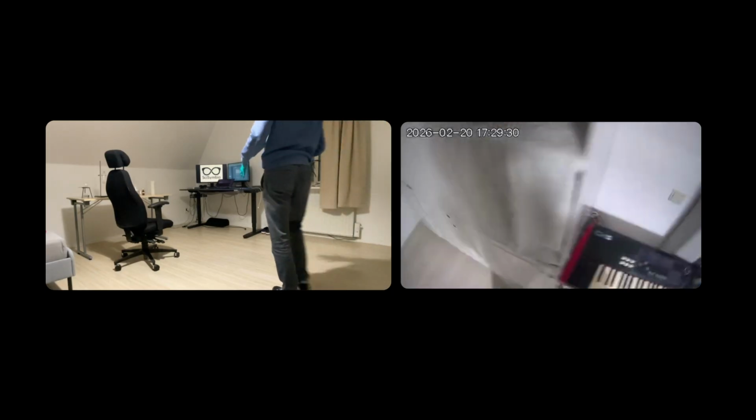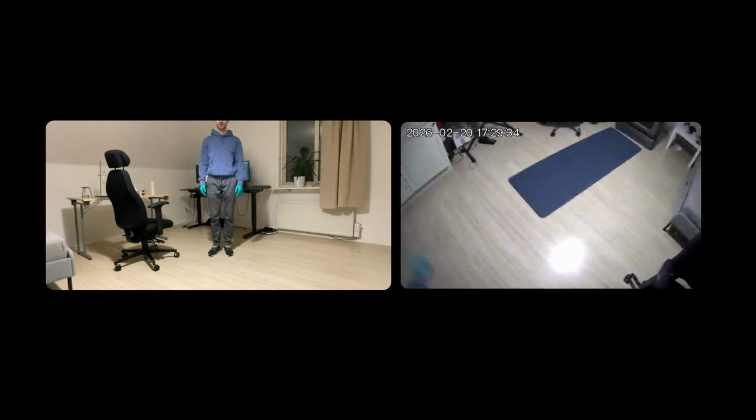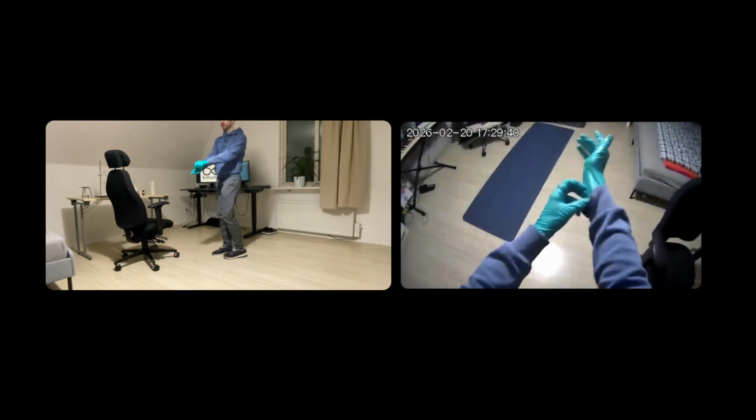Okay, so this was the experiment, and now we're going to have a look at the actual documentation that is being generated. We can stop this, we can upload it.